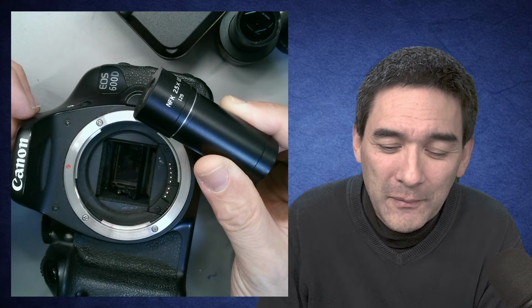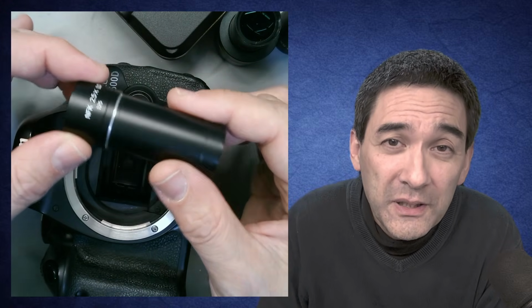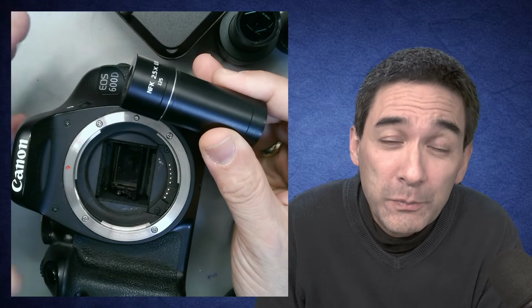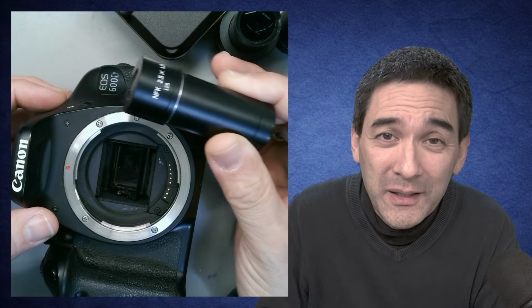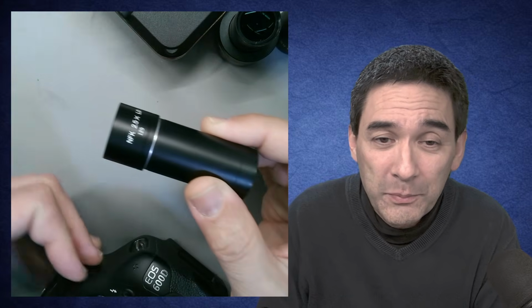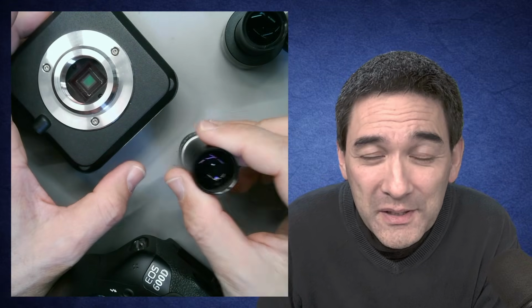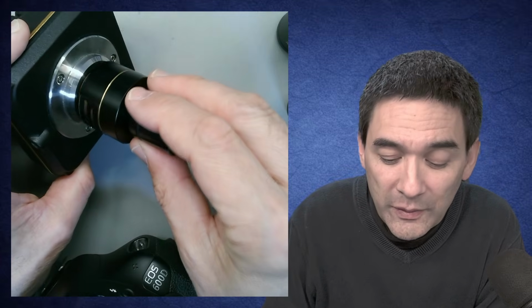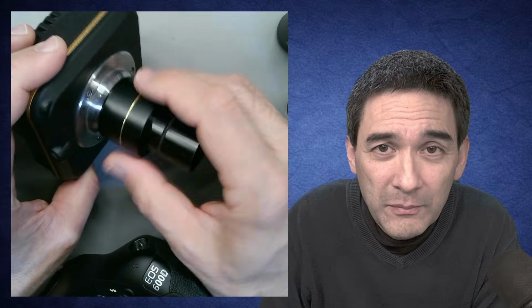But I think the important point is that the magnification of those intermediate optics must be adjusted to the size of the sensor. That's basically how you select it, and how you have to match this optic magnification with the size of the sensor. Now, for all practical purposes, it really doesn't matter, because when you buy a microscope camera like this, it will already come with the correct intermediate optics attached.